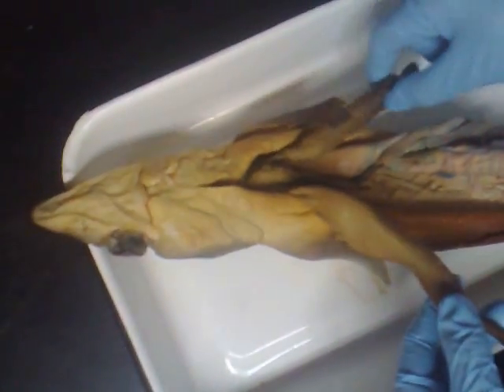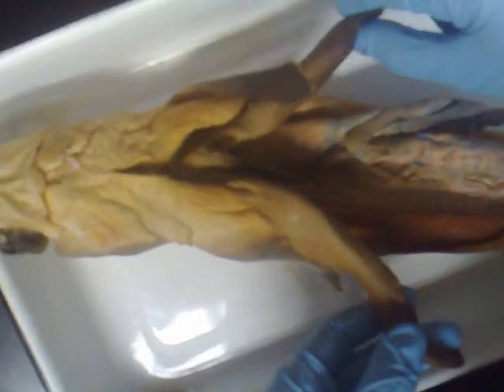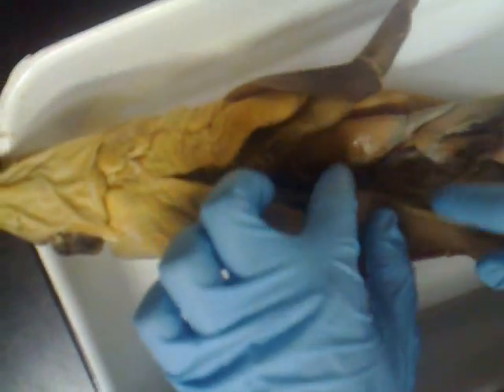This is the right lobe of the liver. This is the left lobe of the liver. The gallbladder is underneath here.